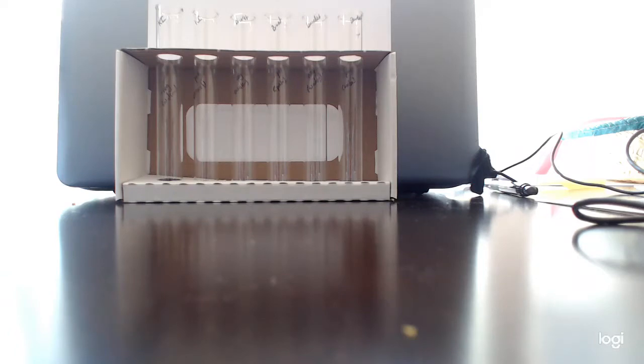And what I'm going to do is 3 sets of experiments. The one for starches, the potassium iodide test labeled KI. I'm going to do the test for proteins in these tubes marked Biuret in the middle. And I'm going to do the test for carbohydrates, small carbohydrates, monosaccharides and disaccharides, in the tubes labeled Benedict on your right hand side.